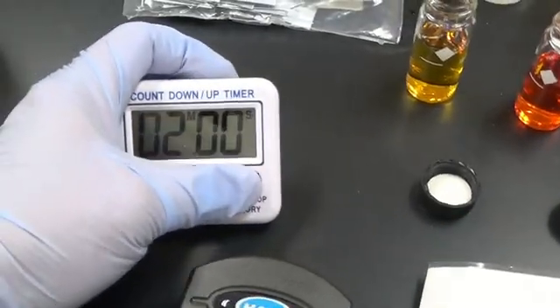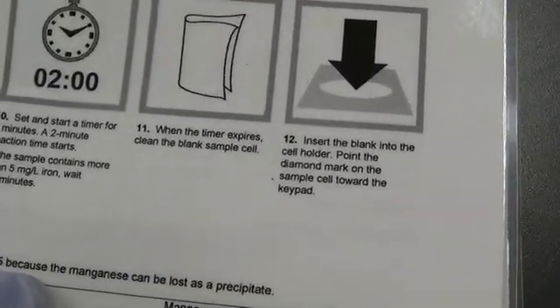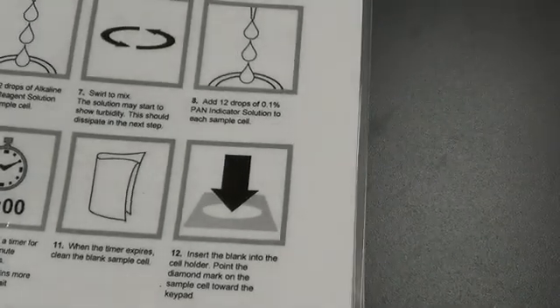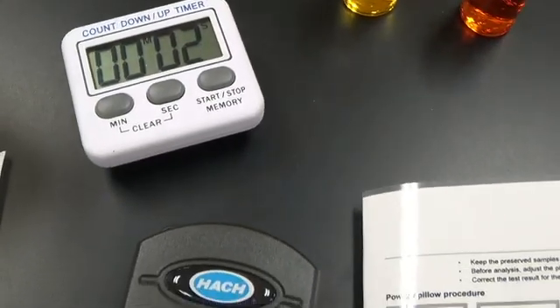After swirling, I set the timer for 2 minutes. We have to wait 2 minutes until we read the blank. Almost there.